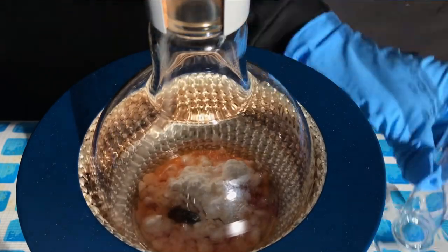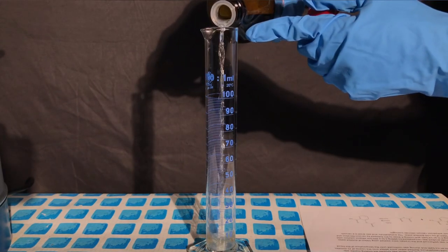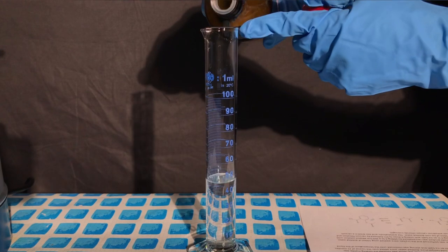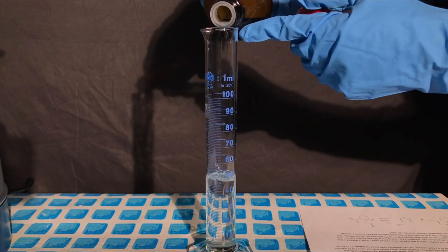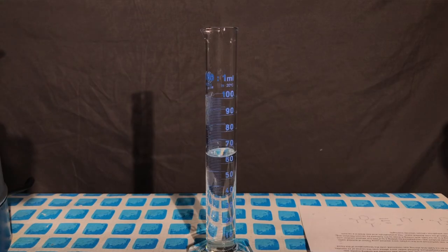If you have pure sulfuric acid, you could just add a few drops of it. Here is an excellent example of why you should melt the reagent you want to use completely before pouring it — the block of glacial acetic acid ice started to move and a bunch of it was spilled. This happened not one, but two consecutive times. I learned from my mistakes and it won't happen again, but this is an example of why gloves and safety goggles must always be worn in any lab.